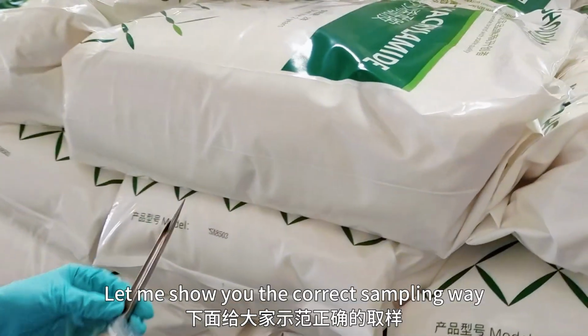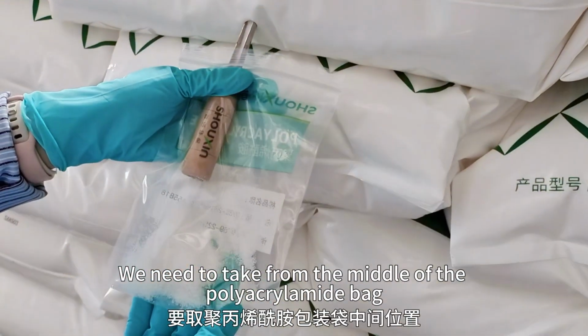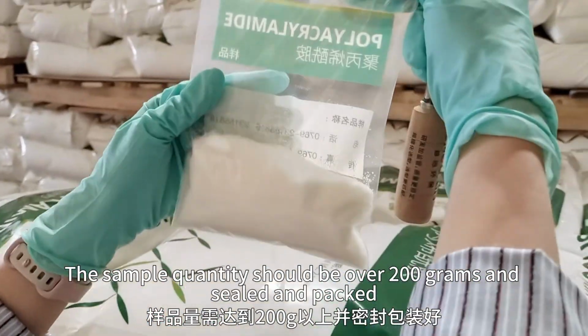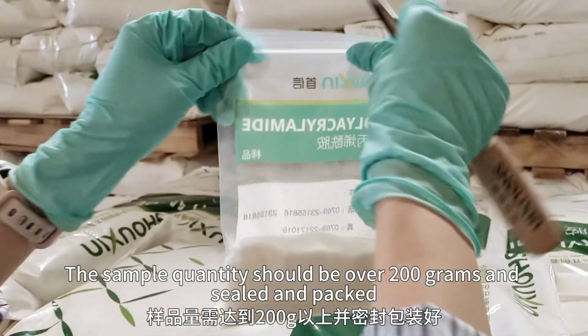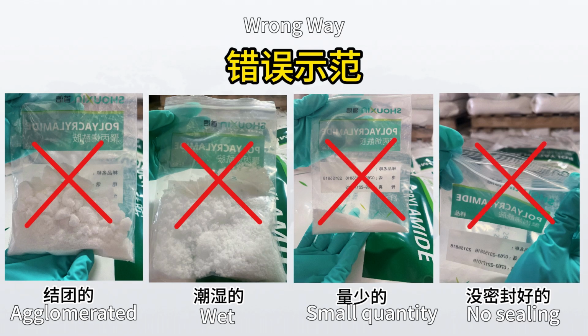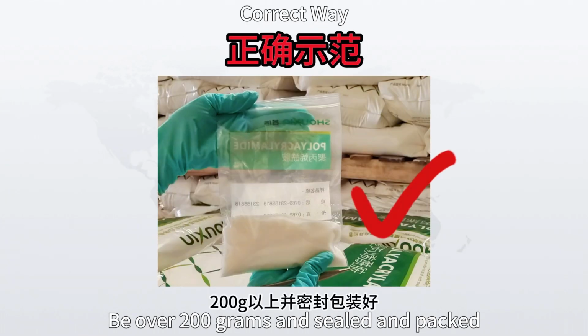Let me show you the correct sampling way. We need to take from the middle of the polyacrylamide bag. The sample quantity should be over 200 grams, sealed and packed, so we can do scale selection. The above are the wrong and right examples of polyacrylamide sampling.